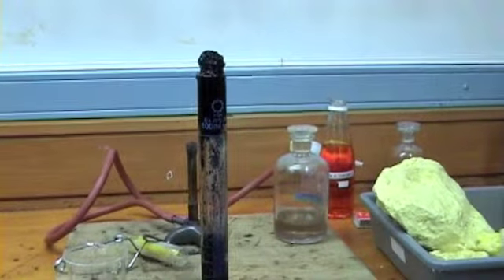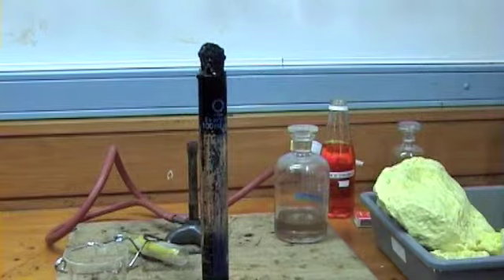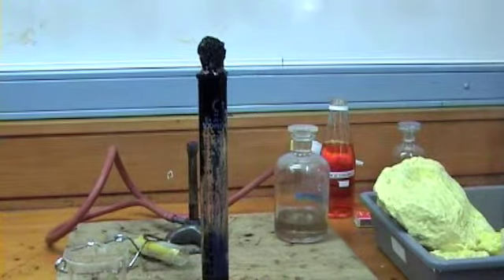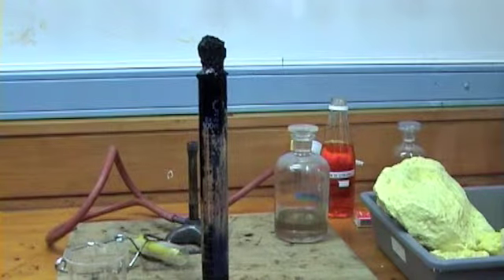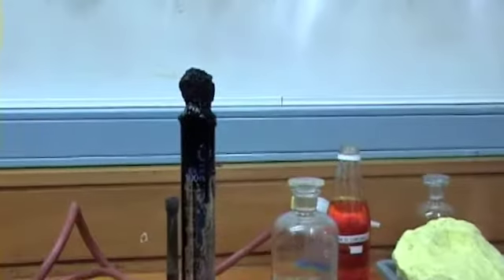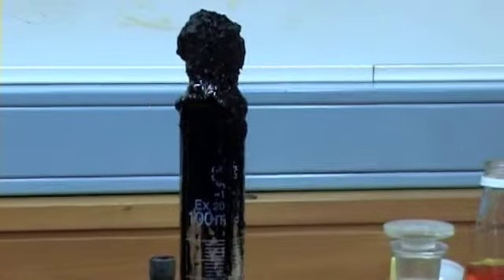Oh, it smells like hokey pokey. Oh my god. What the hell? It's like a gas in the bottom. Keep on going. Why does it smell like hokey pokey? But that's caramelization you can smell. It started with sugar. Oh yeah.